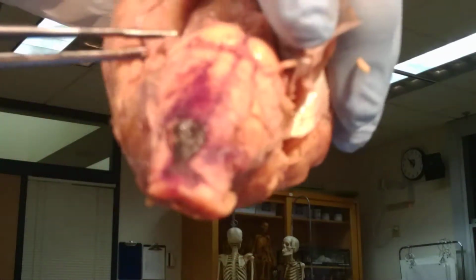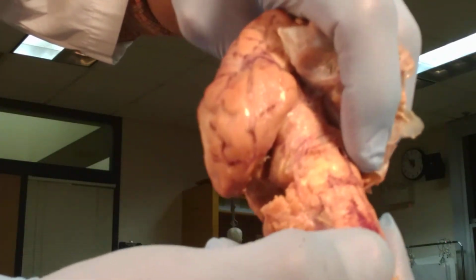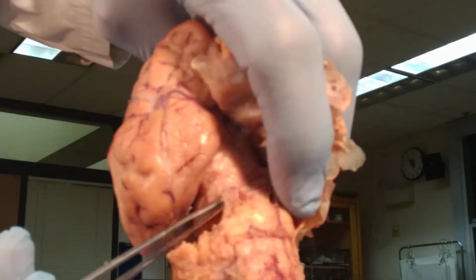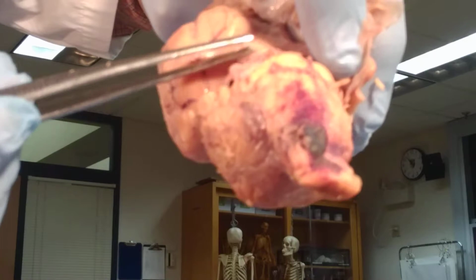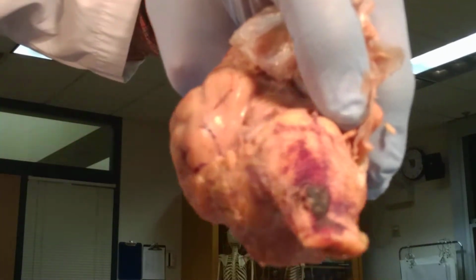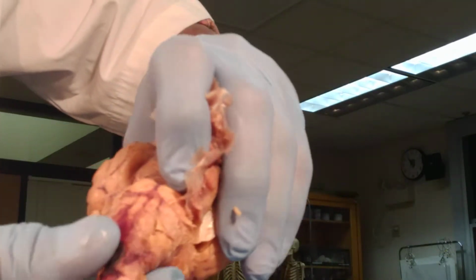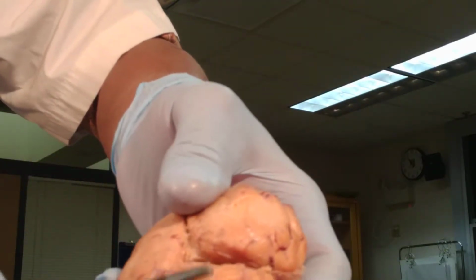And this is our midbrain. If I tilted the brain stem a little bit here, or the cerebellum, this is going to show you your midbrain, I'm sorry. And the midbrain, of course, is part of the brain stem. We know the brain stem is the medulla, the pons, and the midbrain. And this is the cerebellum.